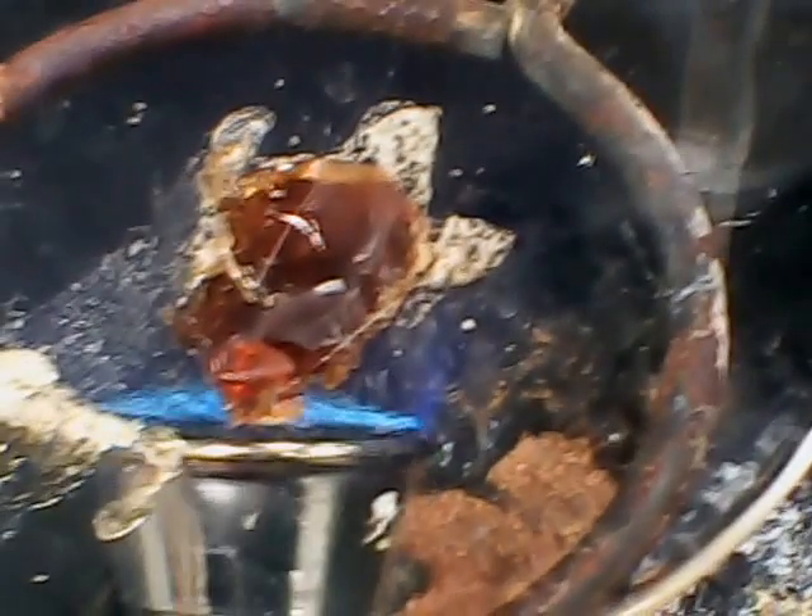I'll have to put this on a tripod and redo the film. It's burning everywhere on the sides there — can you see it? Some smoke, but clean.